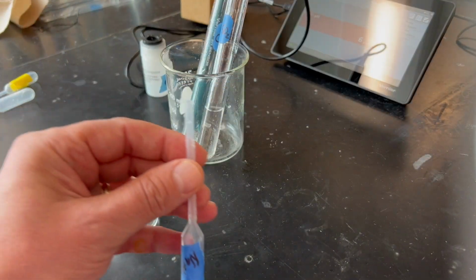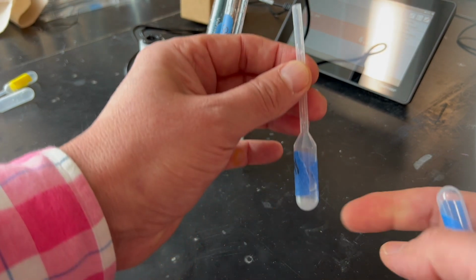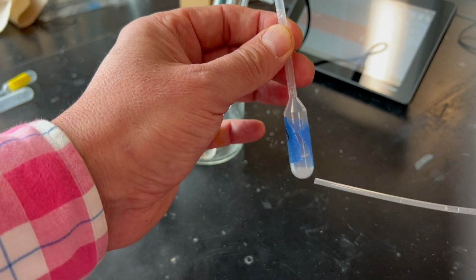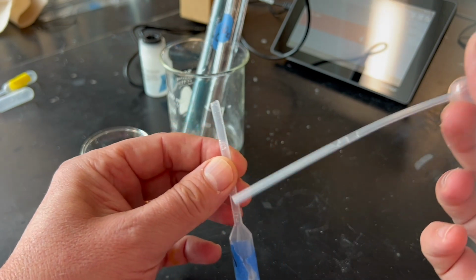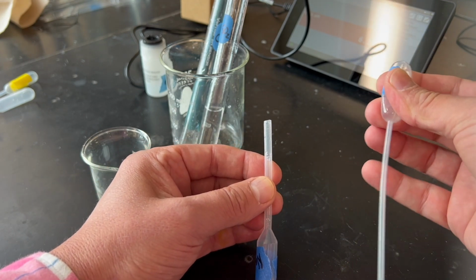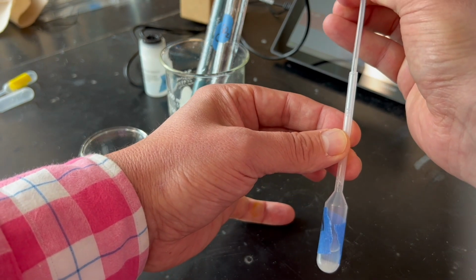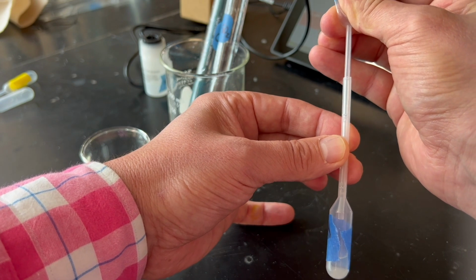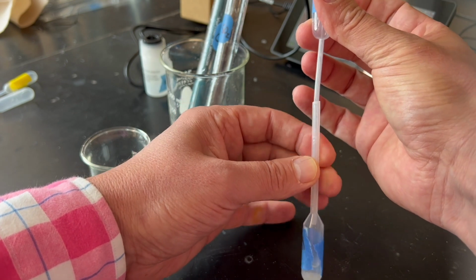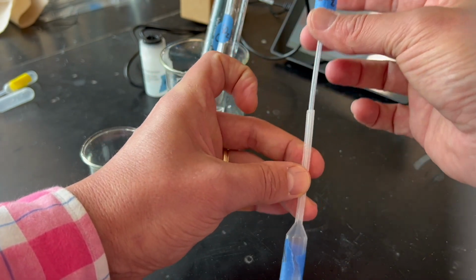So now to test the effect of the gas, we're going to take the pipette where we generated the gas with the reaction of the hydrochloric acid and the sodium bisulfite. We're going to take another thin stem pipette labeled SO2, squeeze the pipette, and slide it into the other one that contains the gas. We're going to slide it all the way in, making sure we don't touch the solution, and just release our fingers, just let go, and the pipette fills with the SO2 gas.